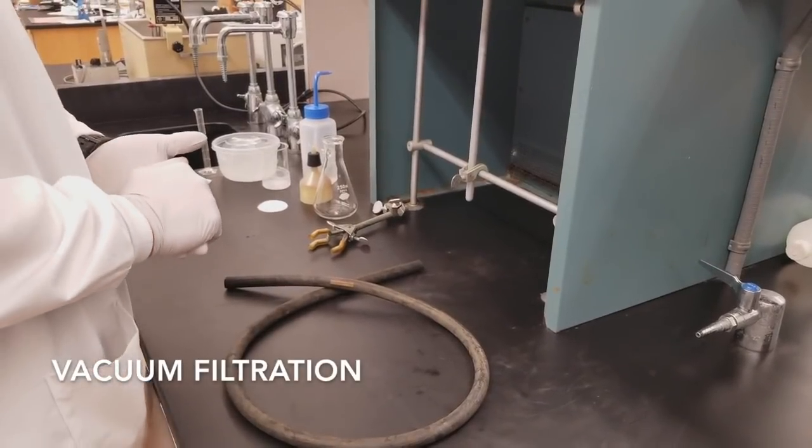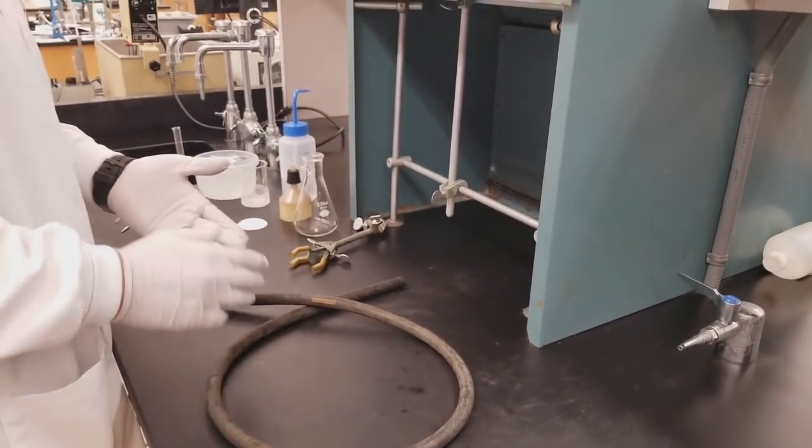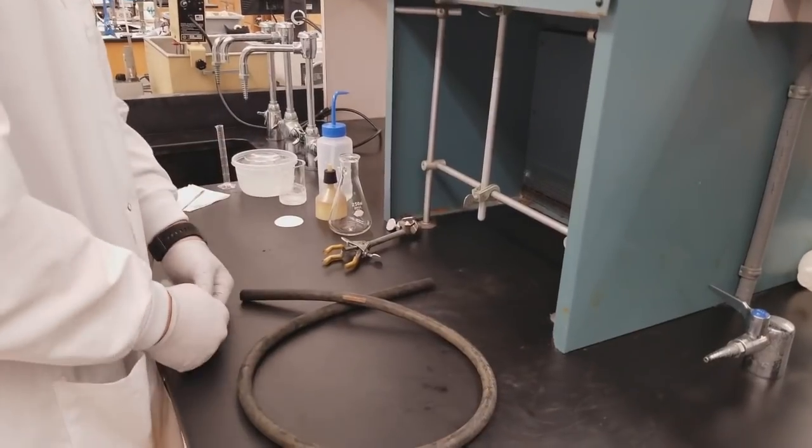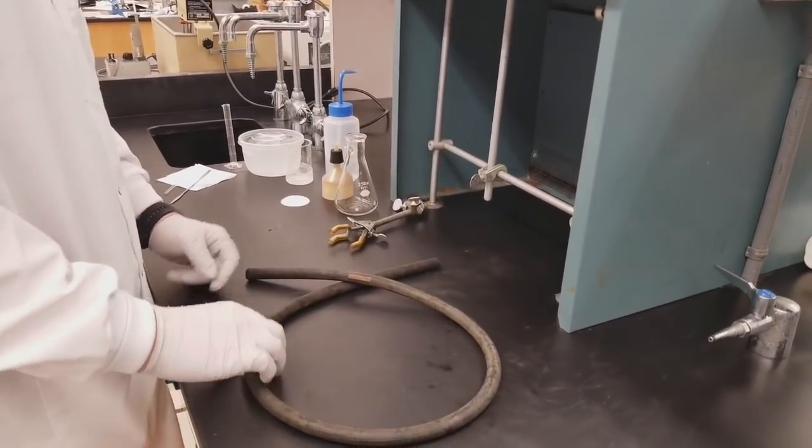This video is going to detail how to perform a general vacuum filtration. So we have everything we need here to set up our apparatus.